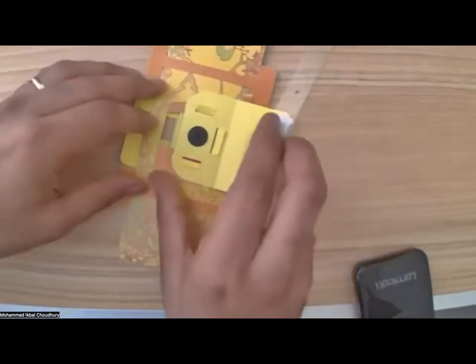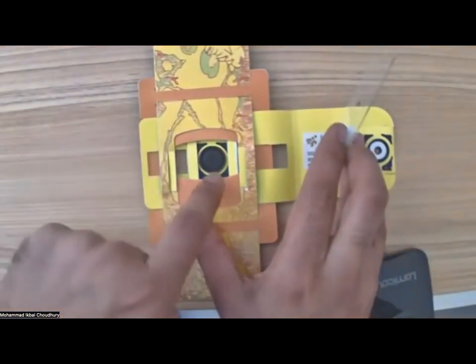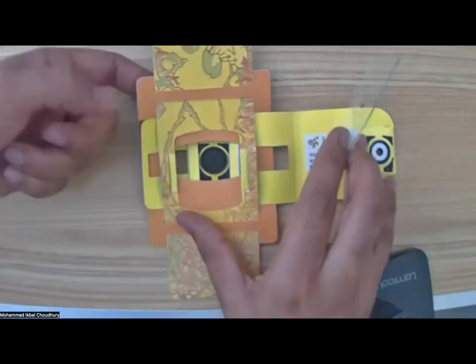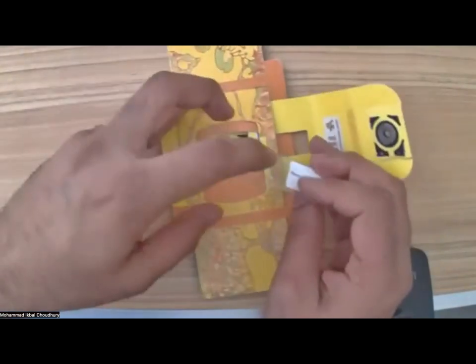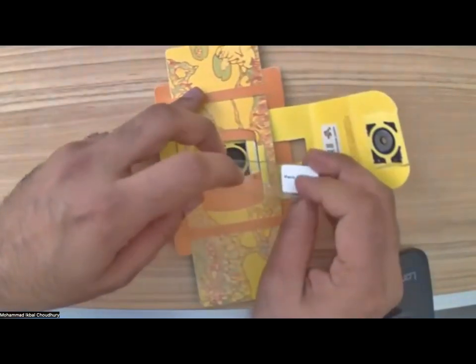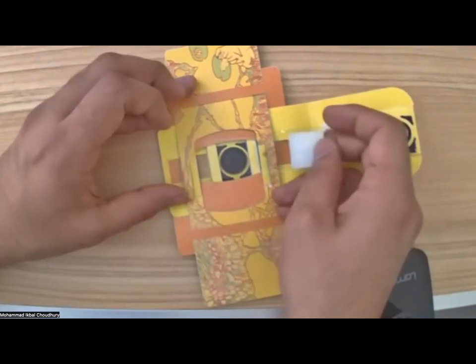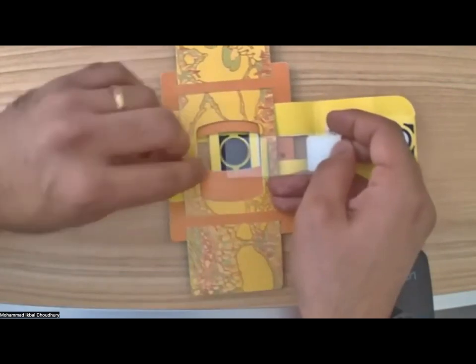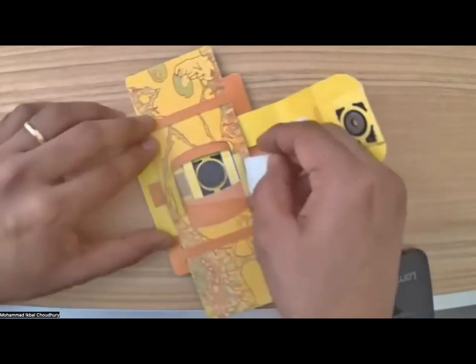So if I keep my microscope on the desk like that, the lens is there. So your eyes are going to see it from that side, right? So let's keep the sample side, the glass cover slip, towards the lens. We are going to insert it into the foldscope like that. So I'll lift this flap here, and I will insert it in this direction.